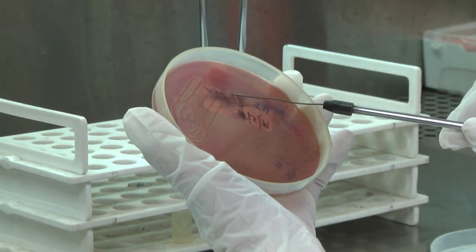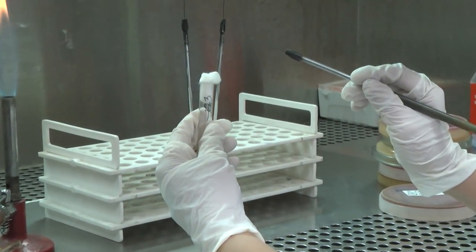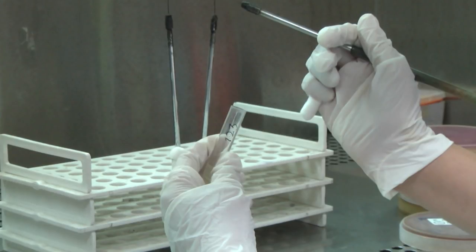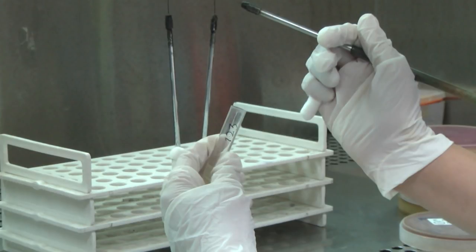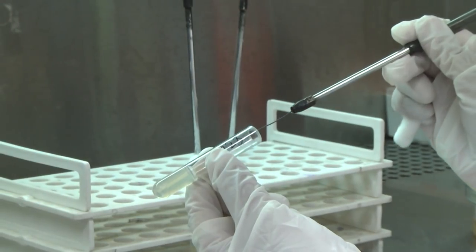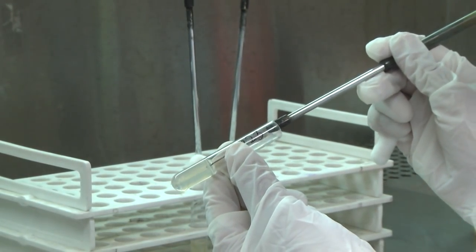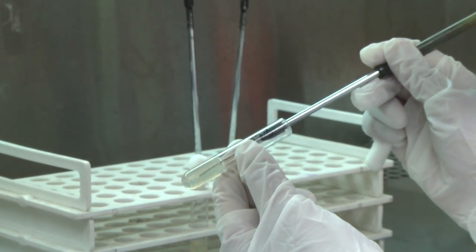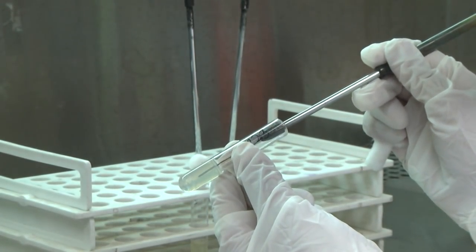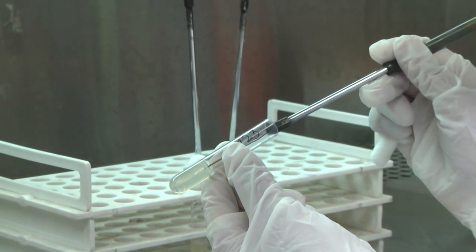Hold the agar medium in your left hand and remove the cotton plug or cap with the little finger of your hand and flame the neck. Then, plunge the loaded inoculating wire into the center of the medium in a straight line, taking care to withdraw the wire in the same line to avoid splitting the medium.